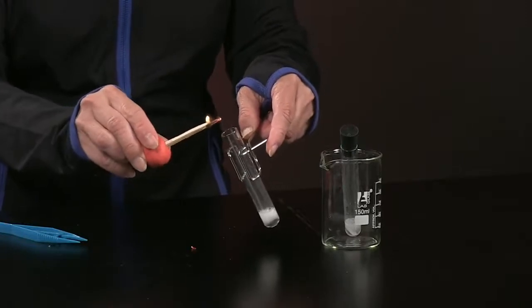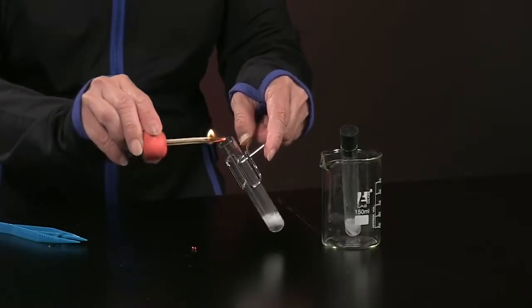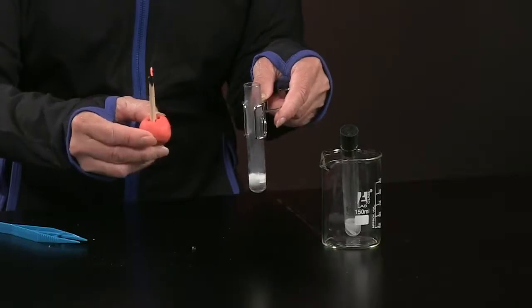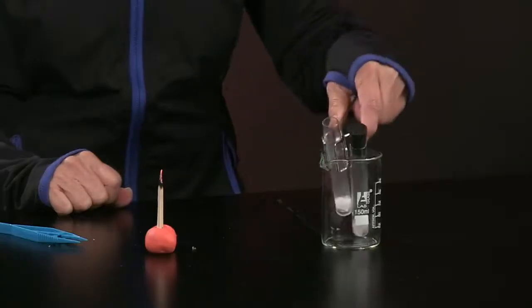Do you see how wild that reaction is? Did you hear that? That is a very special gas that's being produced. That's what I wanted you to see with the zinc. It wasn't happening fast enough, but it's certainly happening fast enough with the magnesium. Remember that gas that's produced is exactly the same gas as what's being produced right now with the zinc and the hydrochloric acid.